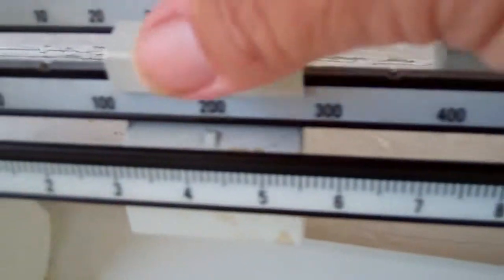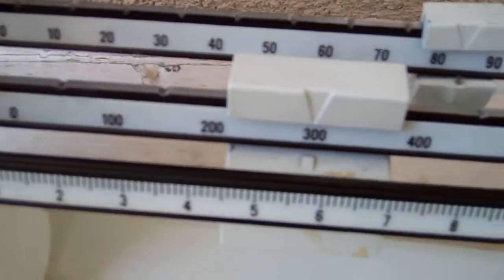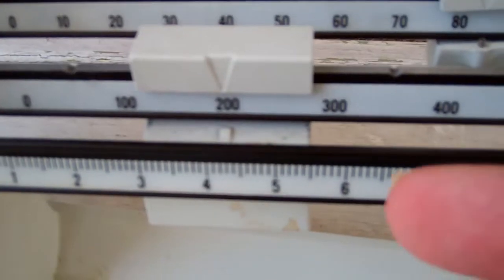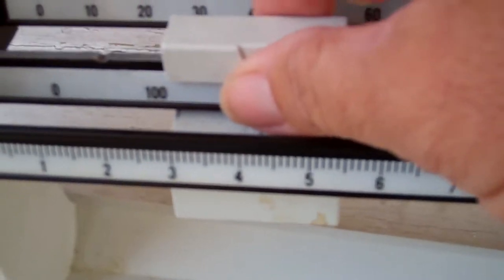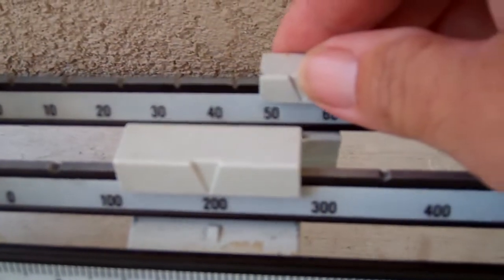So there. It's up. If I go to 300, it goes down. So that means it's more than that, less than that.